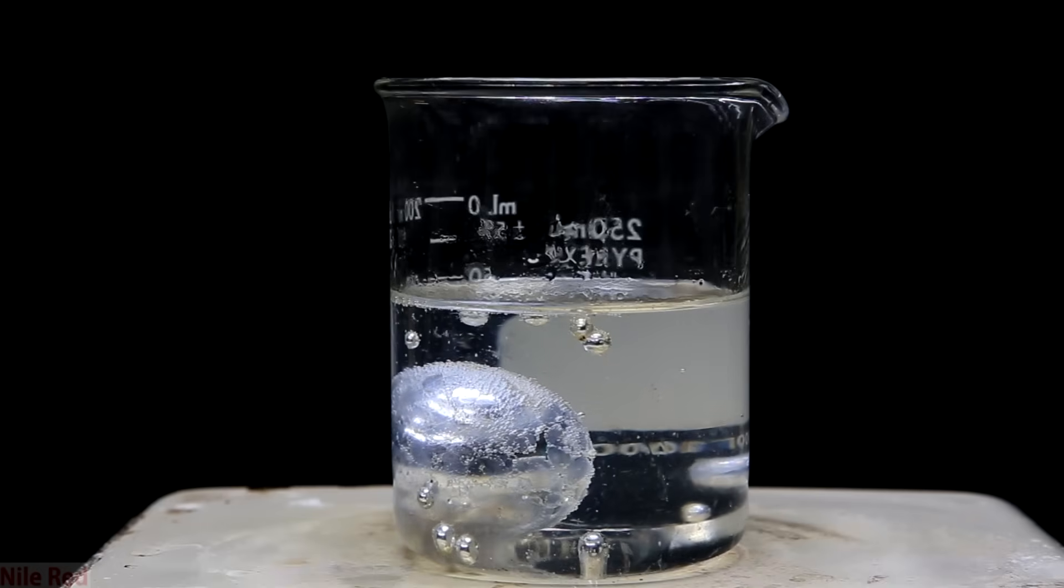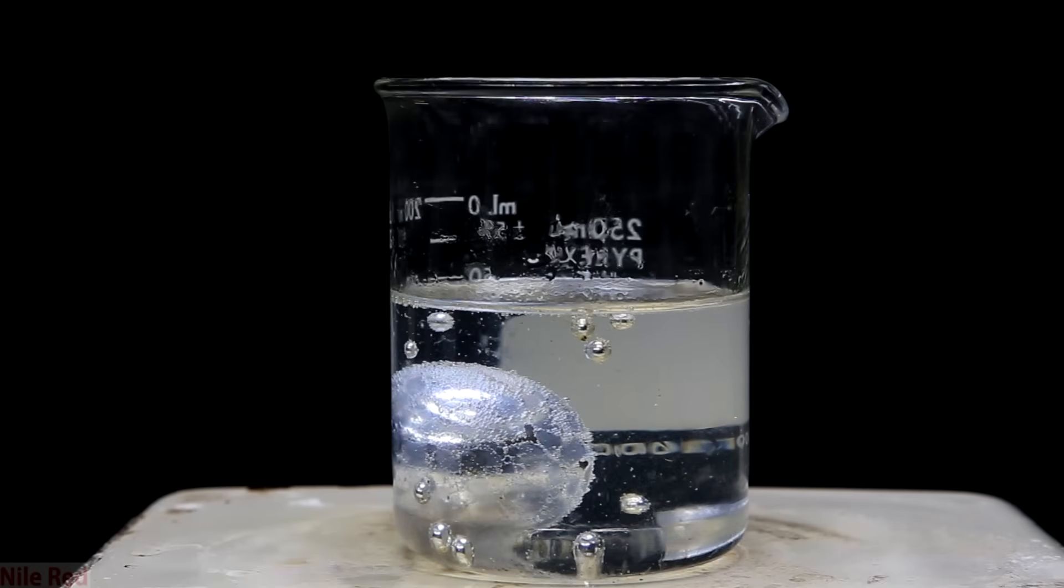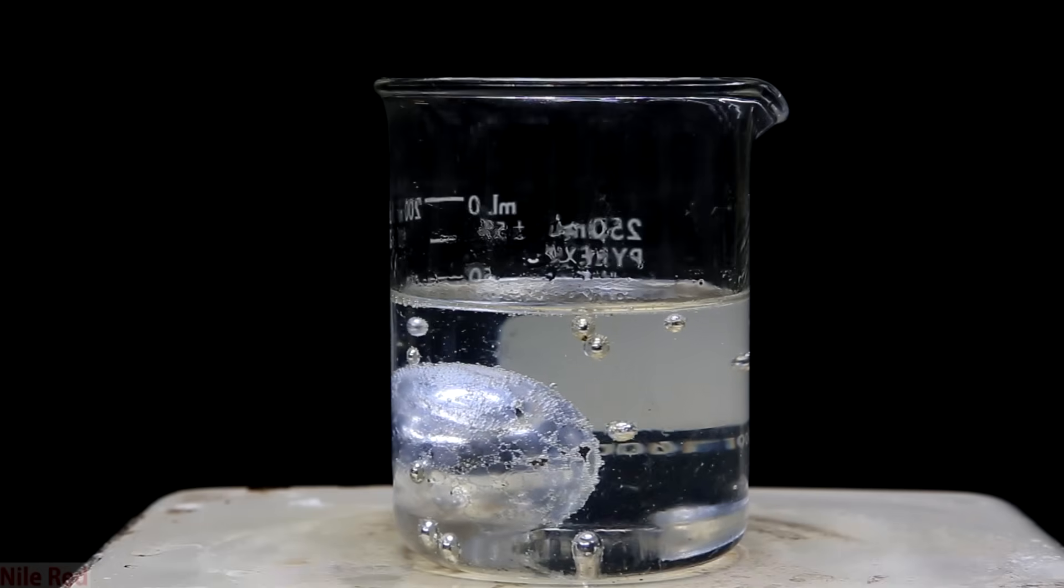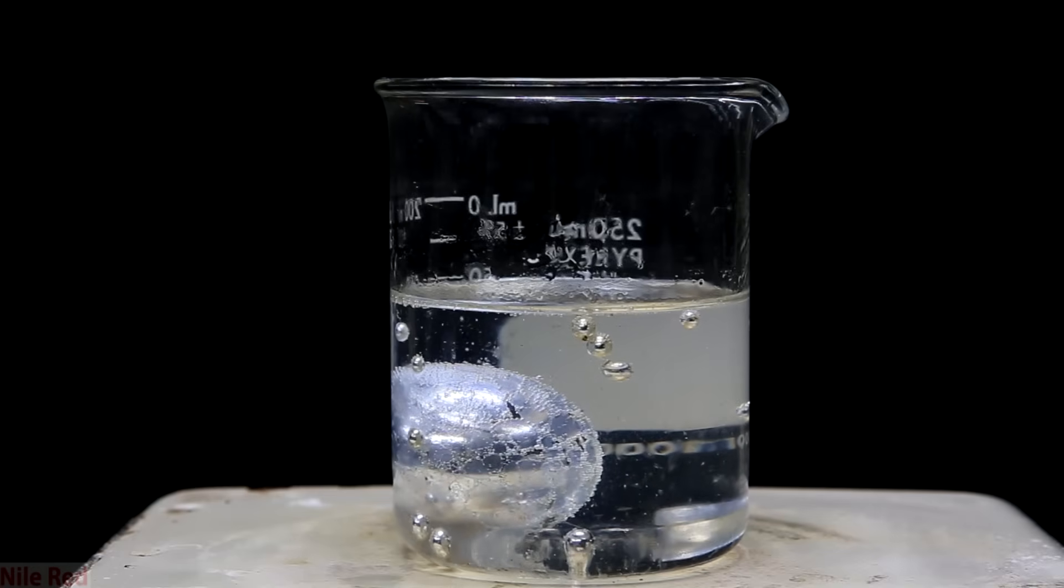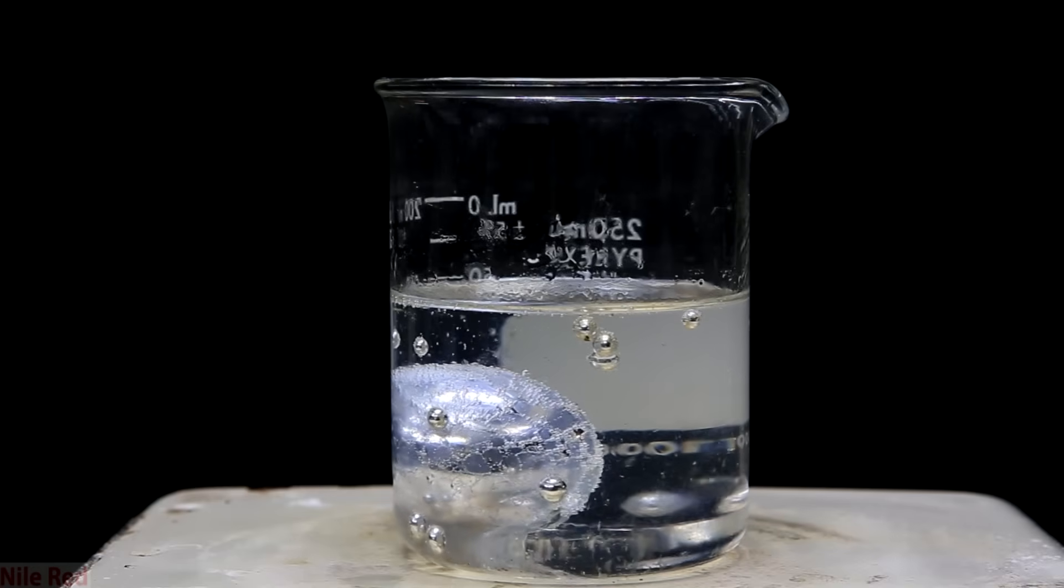In the end though that doesn't really matter and you can see here that besides a thin white film, the potassium is pretty clean. So at this point I was satisfied and I let it cool down back to room temperature.